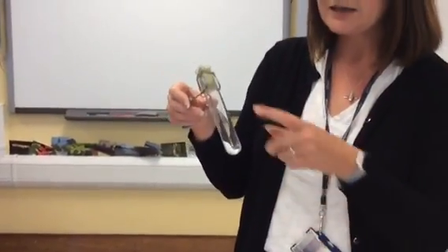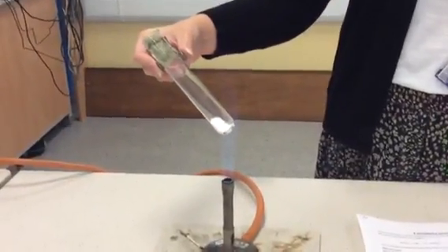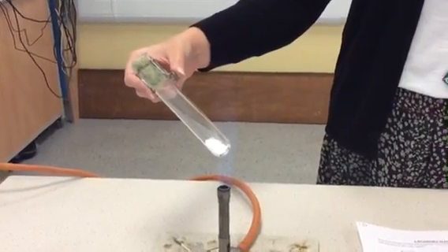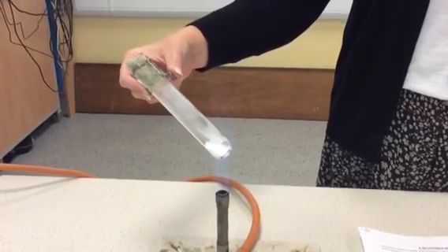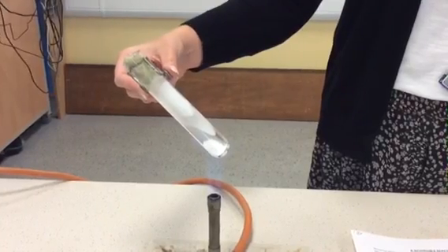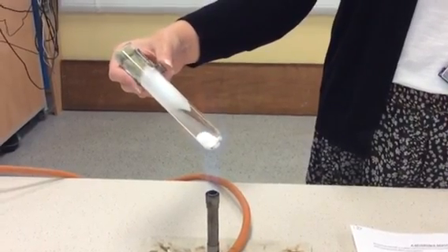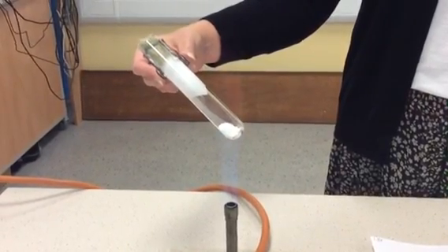So as we heat it, let's see if we can see anything happening in our boiling tube. We're heating it on a blue flame and looking to see if anything happens to this ammonium chloride. We should see something happening fairly shortly, because remember at the beginning we just had white solid at the bottom and there was nothing else in the boiling tube. Whereas now we're heating it and we can definitely see something happening, and we need to be able to explain what's happening in our boiling tube.